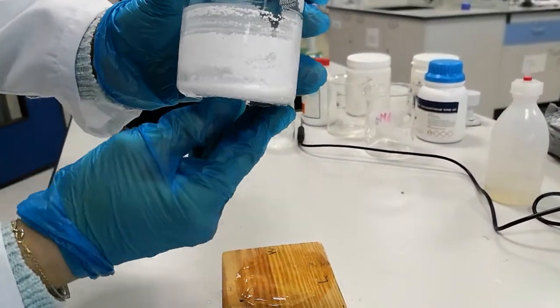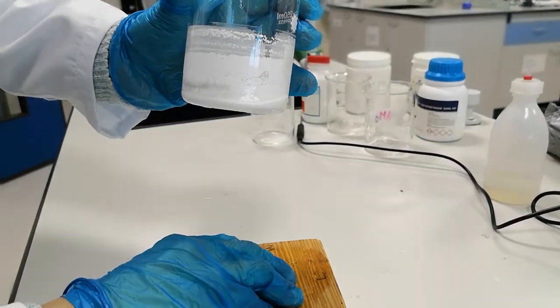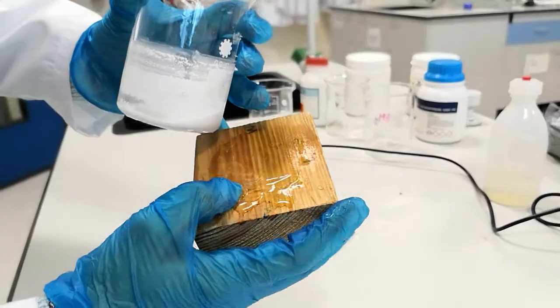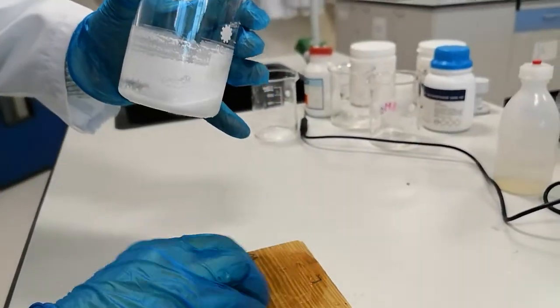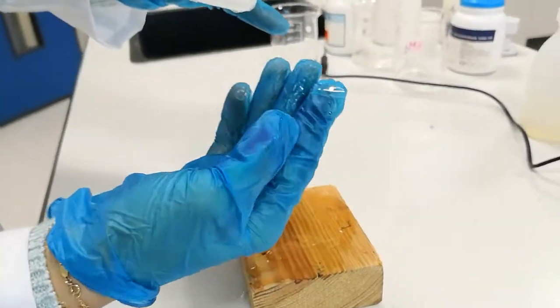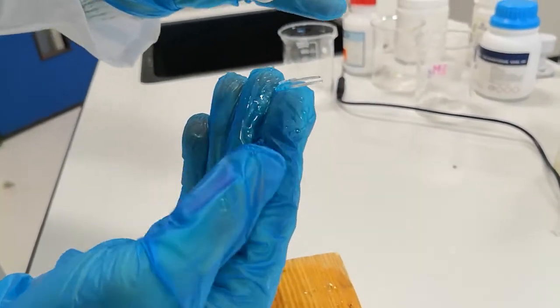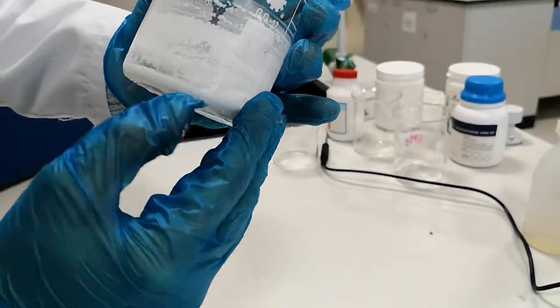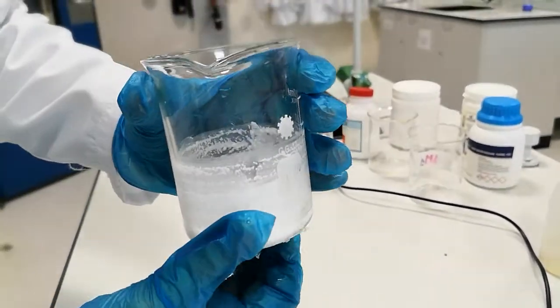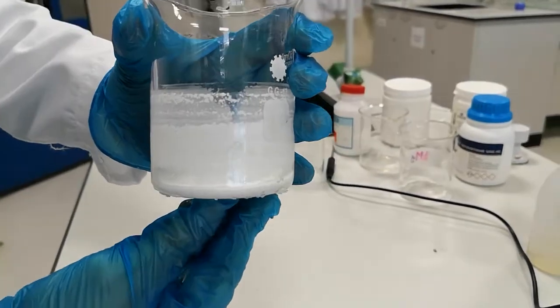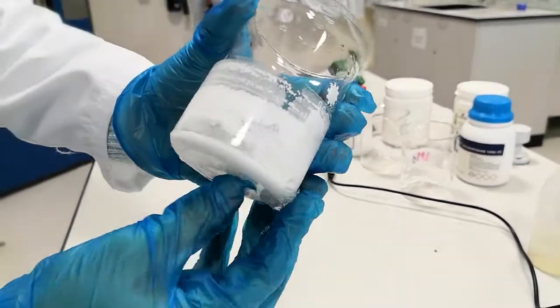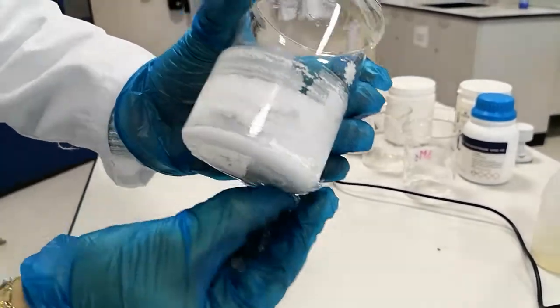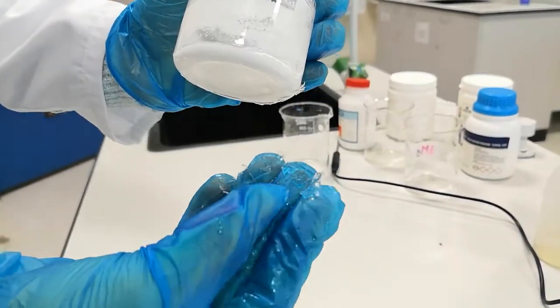The water that was between the beaker turned to ice. See the pieces of ice. This is an endothermic reaction. This experiment, this reaction, absorbed the heat that was in the water and turned the water from liquid to solid.